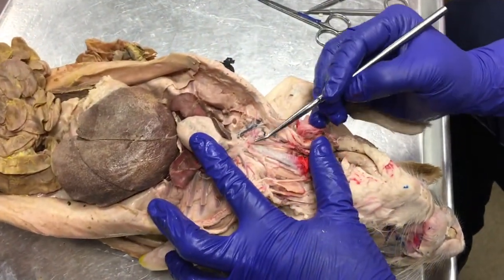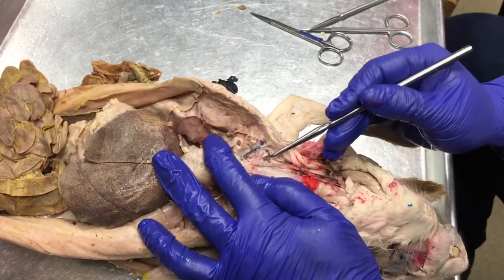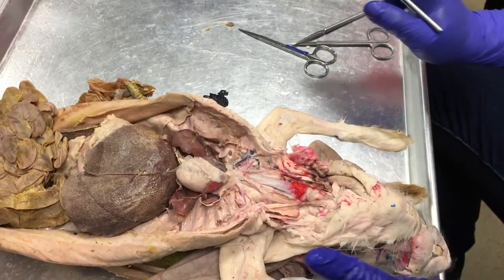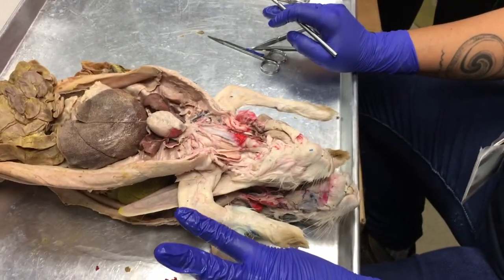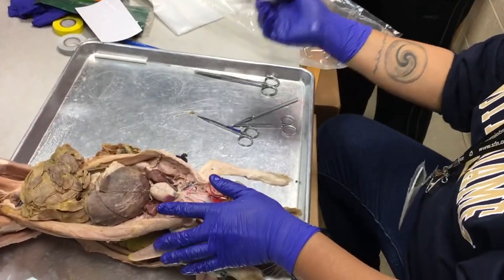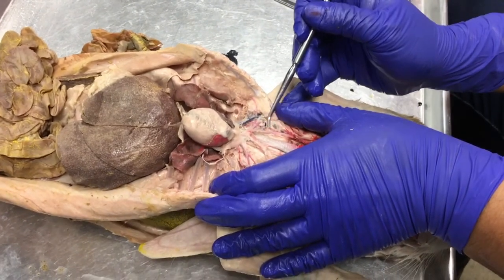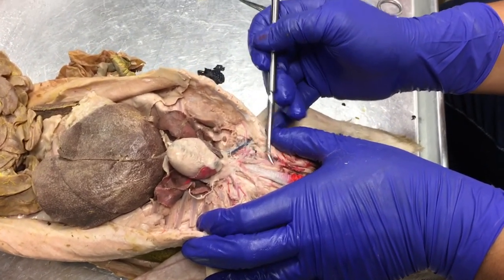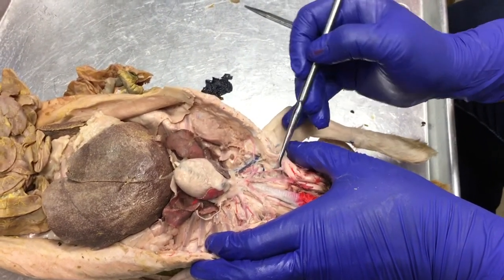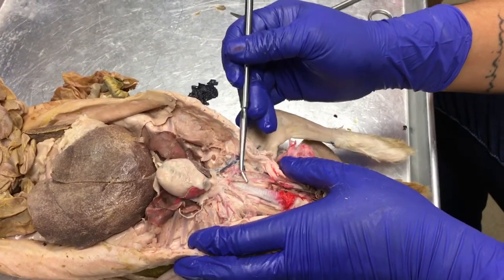Okay, so after our common carotids branch up toward the head, then we have the right subclavian artery branching into the arm. So you're going to have to look for 3 branches from the right subclavian artery. There's a branch that's coming off anterior toward the head, and then 2 branches that are coming off posterior toward the heart. So here, this anterior branch, this is very nice. Sorry. So this branch, look at it, it's going off toward the inside of the neck, kind of the lateral side of the inside of the neck.